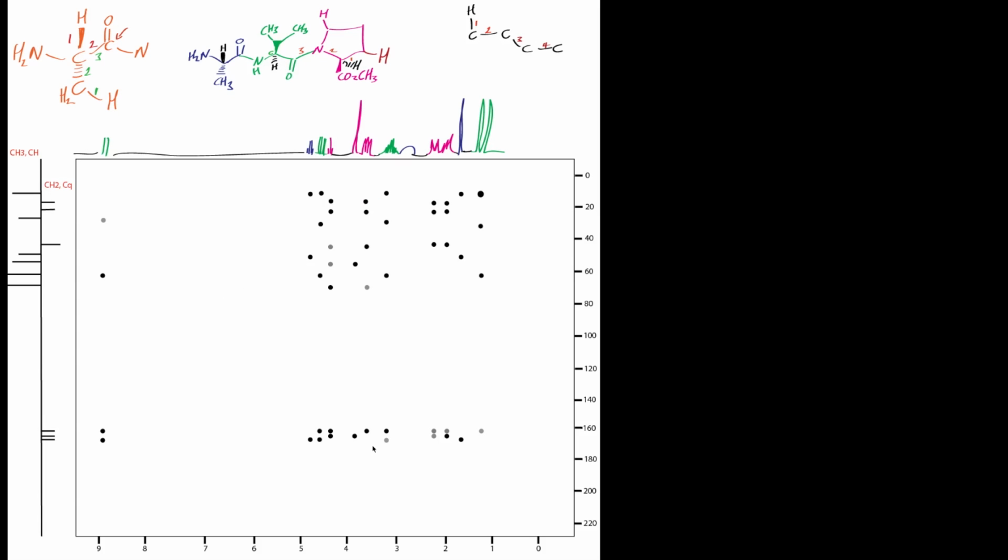Just remember, just do these vertical lines and read it off horizontally. So you're looking at 90 degrees. So you apply one line down, like so, and then just read it off as a line going across at 90 degrees. And stuff like that, and just keep moving up and down to read it off. So that one's that one, that one's that one, and so on. And similarly, if you're just interested in what the carbonyls are connected to, you can read it off horizontally first, and then find out that way what that carbonyl is connected to, and so on and so on.